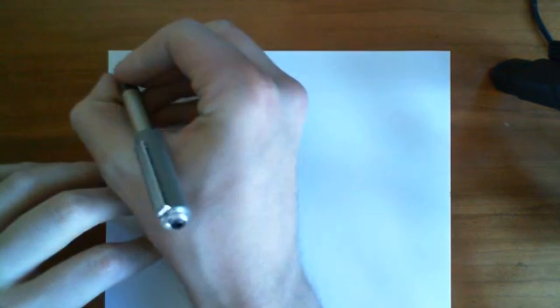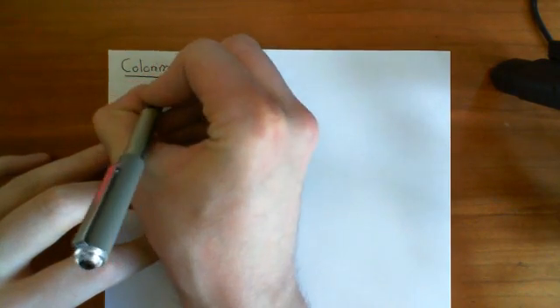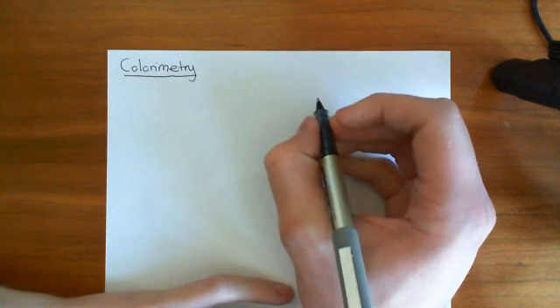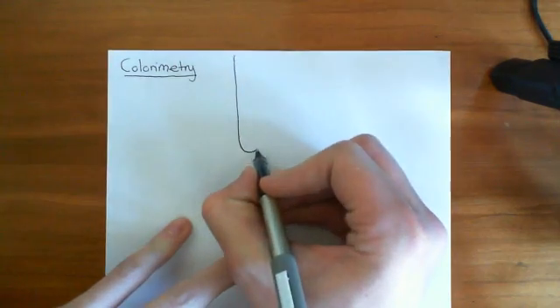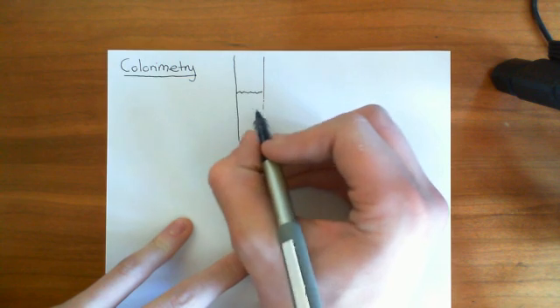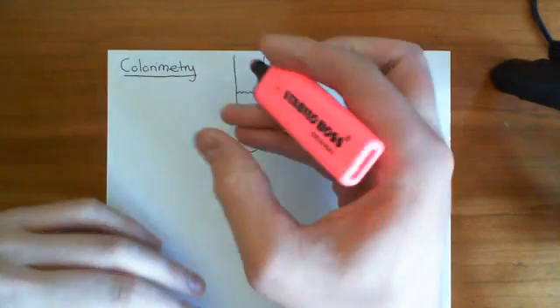In this video we're going to discuss the experimental technique of colorimetry. Colorimetry is basically a way of finding out the concentration of protein or the concentration of DNA which you have in a sample fluid. So let's say we have a test tube here which contains some water or some fluid, and in that fluid you have some protein molecules.